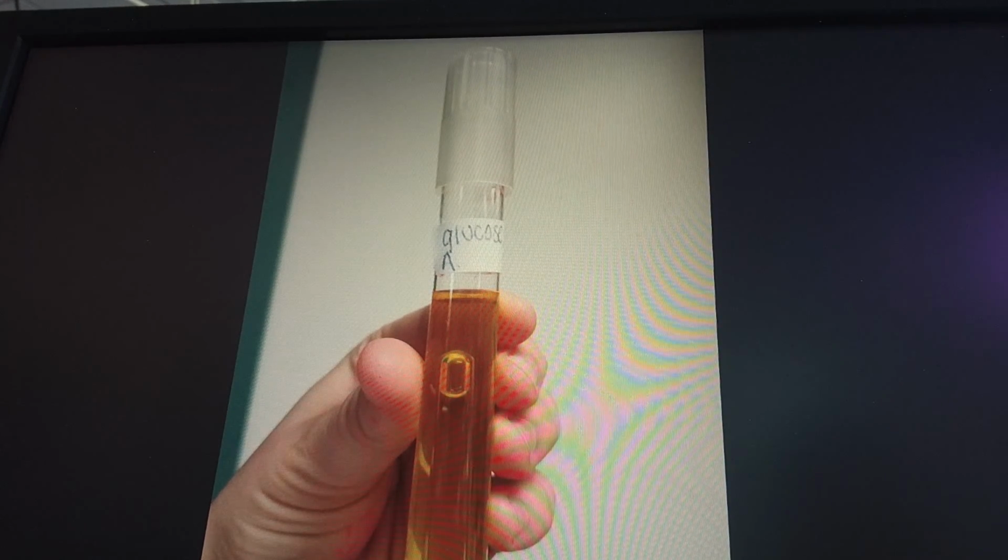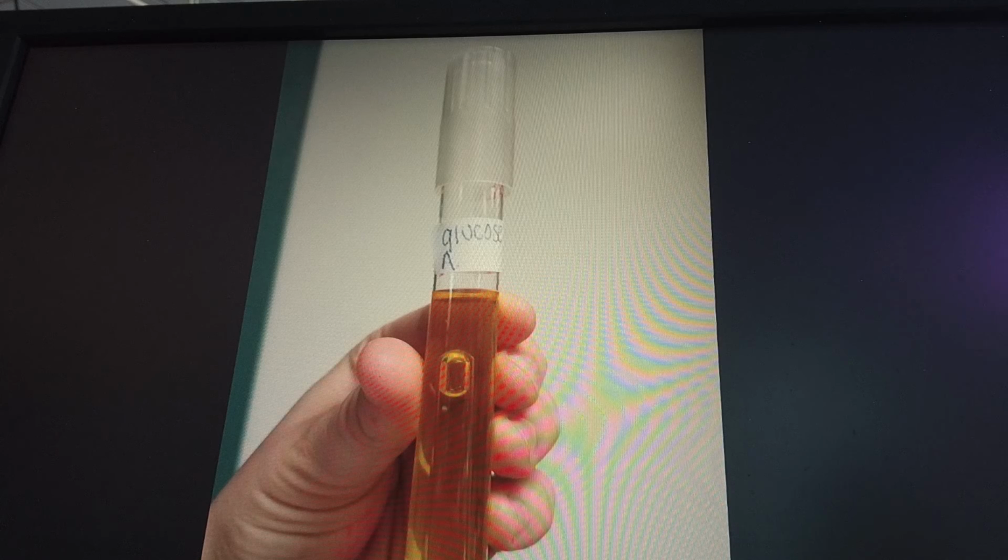A glucose phenol red tests for the fermentation of glucose. The medium is glucose. This test is differential for determining oxidation or fermentation. It also tests for whether or not a gas was produced. If glucose is fermented, the liquid will turn from red to yellow, meaning an acid was produced. If gas was produced, there will be a bubble within the smaller tube. We found that our unknown did ferment glucose and a gas was also produced. This means that our unknown substance is a heterofermenter of glucose.